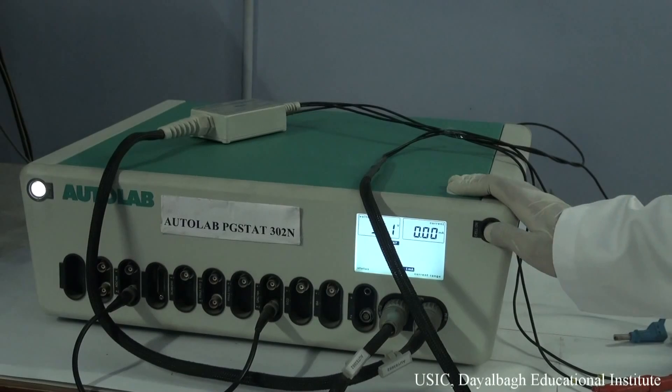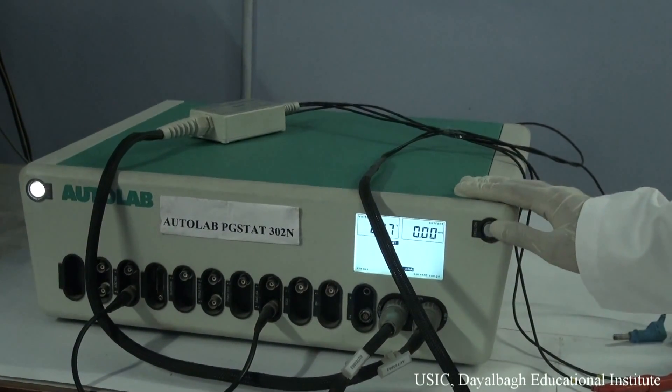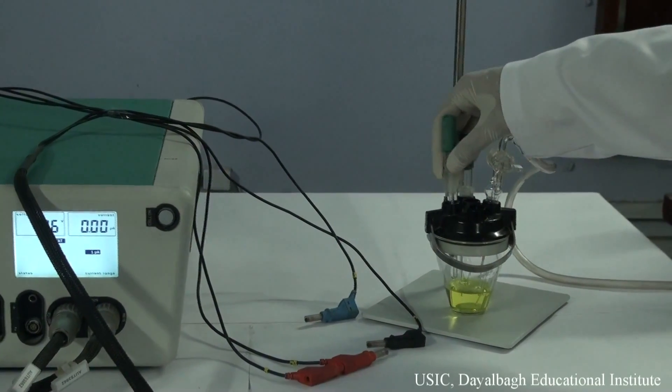Switch on this, this is the electrode part. When we will set up the electrode, we will switch on this button. Now we are using a three-electrode system.